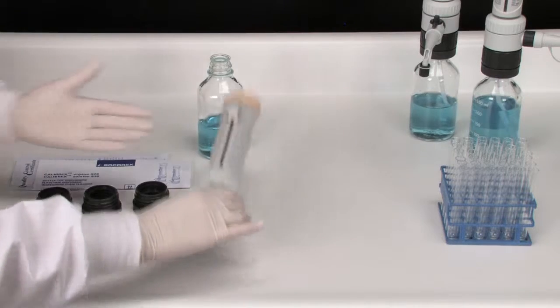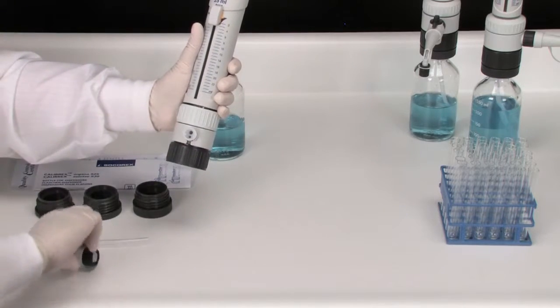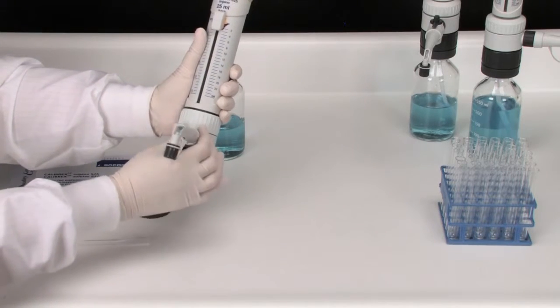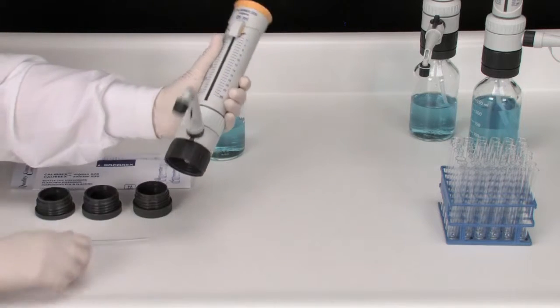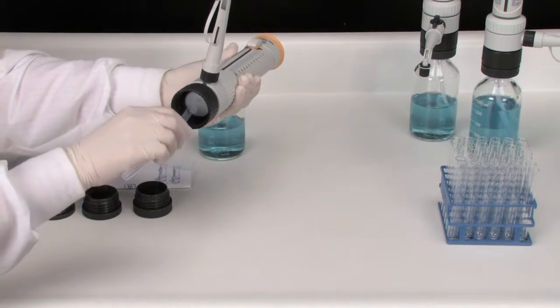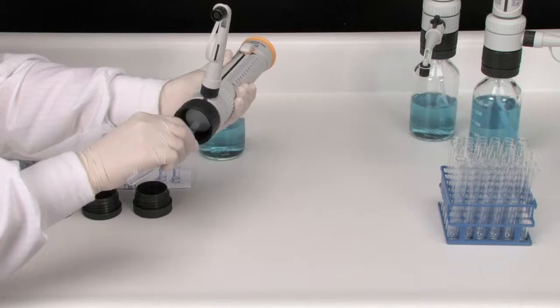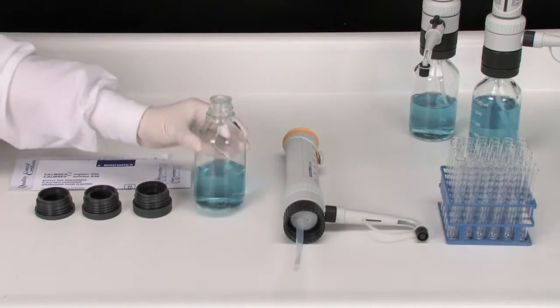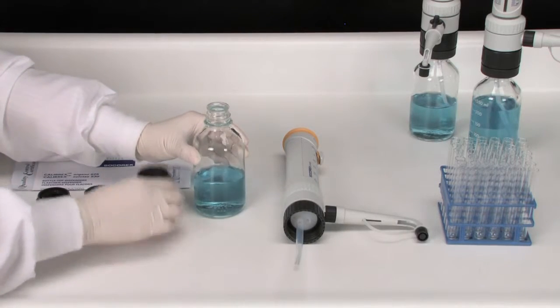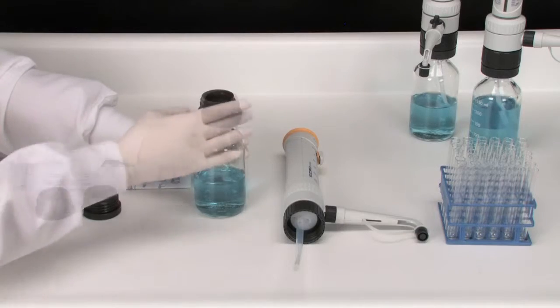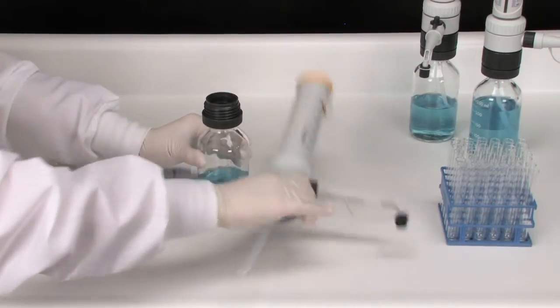Calibrex Dispensers are supplied ready to use. Simply attach the delivery jet, connect the feed tubing, apply the appropriate bottleneck adapter if necessary, and screw on the reagent bottle.